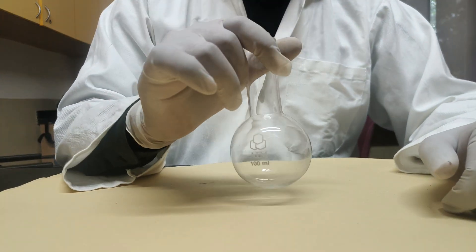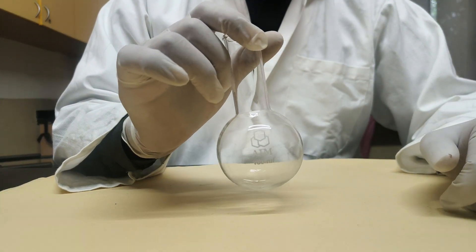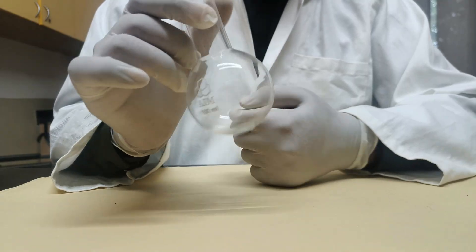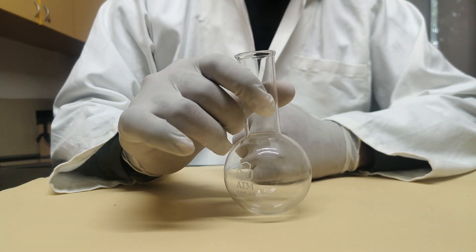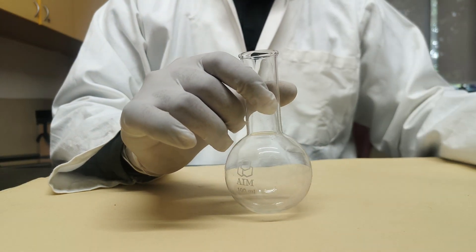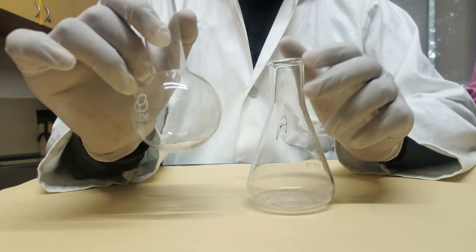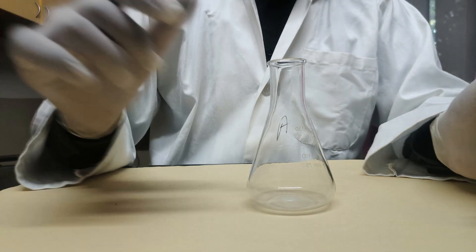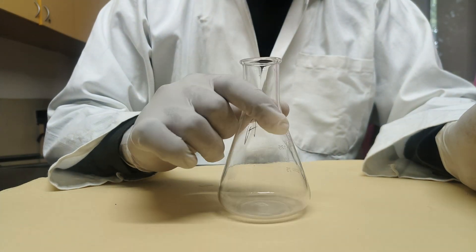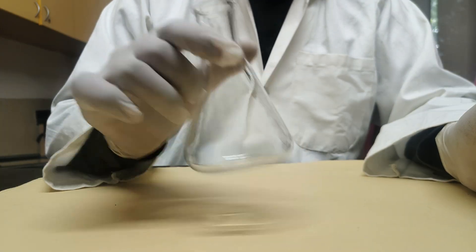Next is the round bottom flask. It is used for heating chemicals over a spirit lamp or Bunsen burner. Next is the conical flask. It is used in titration or the swirling process — we can swirl any type of chemical in it during titration.